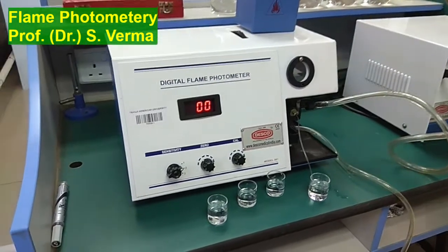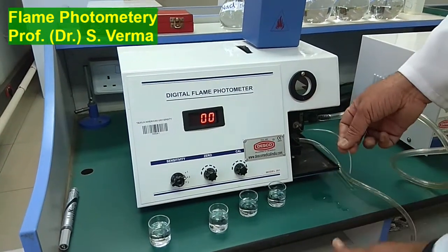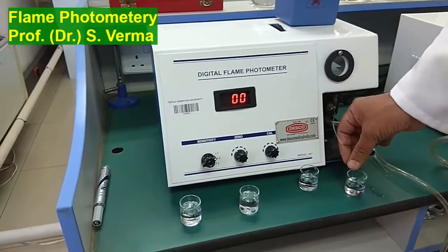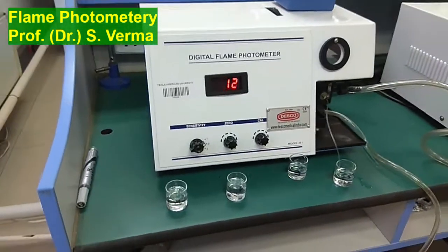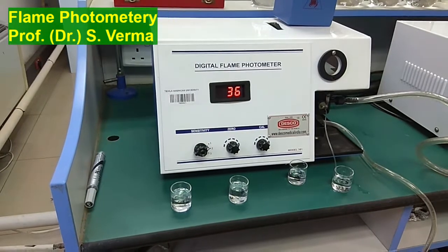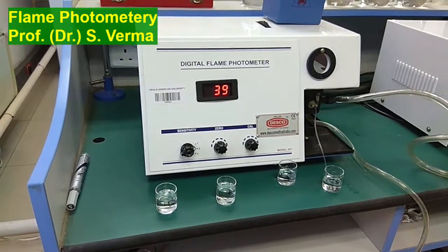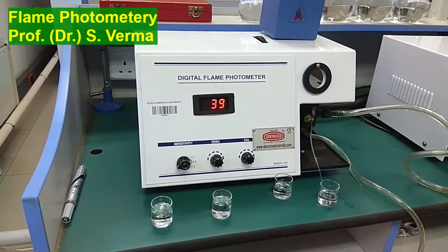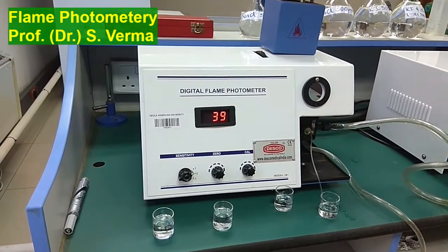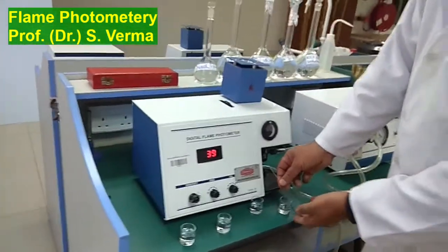So I can take this capillary out and put it in the test solution again, which contains potassium as well as sodium. So it goes in there, but since the filter is at potassium, it will only record the potassium value. So that means our test solution contains 39 ppm of potassium, and we tested sodium as equal to 33 ppm. So that's about this experiment to find out sodium and potassium concentration.